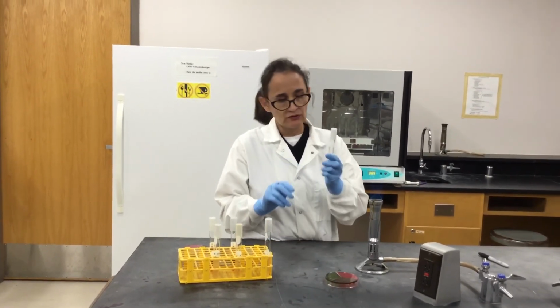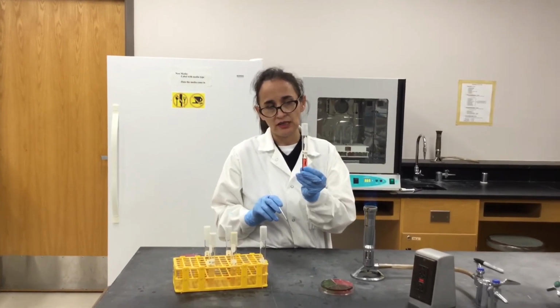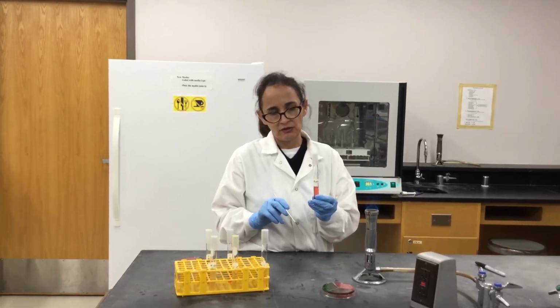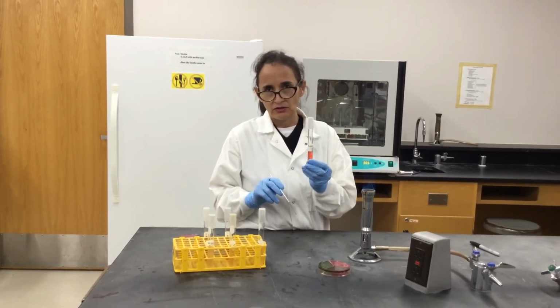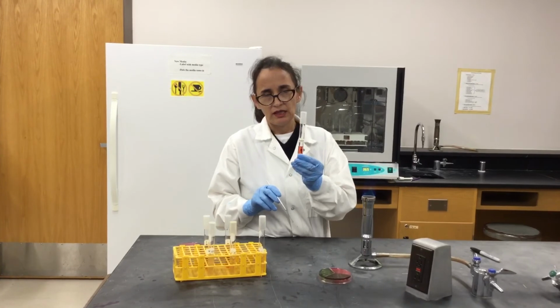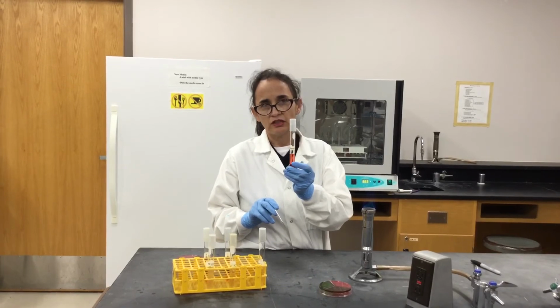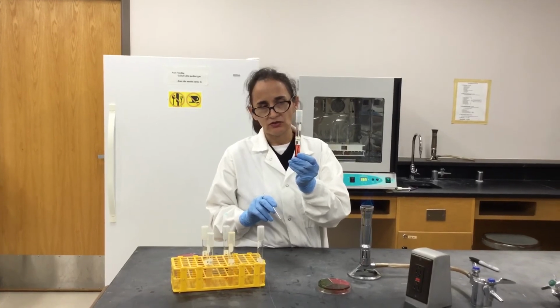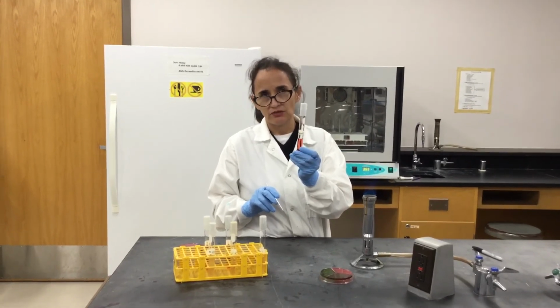Okay, while I wait for it to cool off: enteric bacteria, which is bacteria that lives in the large intestine, some of them can ferment certain carbohydrates. And with this fermentation, they can produce these acids that I explained before, and gas. But some of them don't ferment these carbohydrates and they don't produce gas. So in a bacteria that doesn't ferment these carbohydrates and doesn't produce gas, you don't expect to have a change in color from red to yellow. In this case, the media, since it's going to be alkaline or neutral, will stay red, and you don't see gas production.